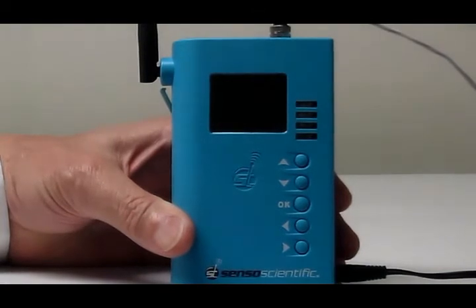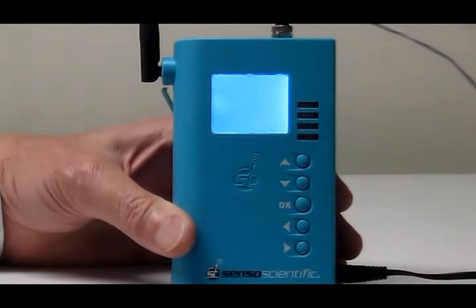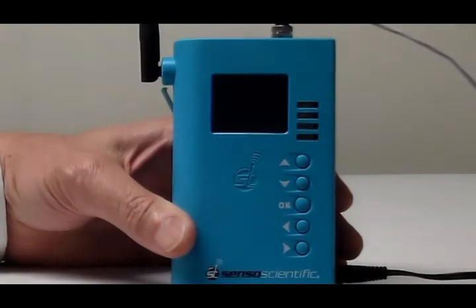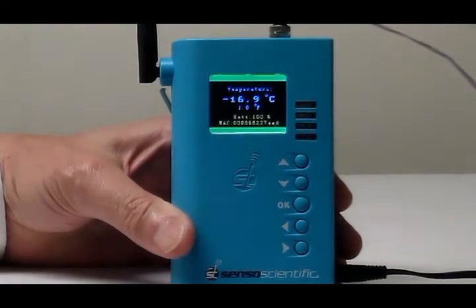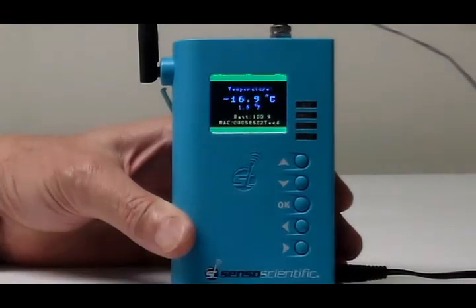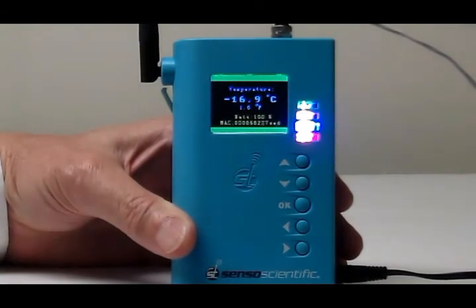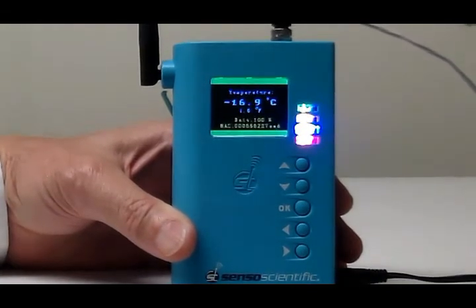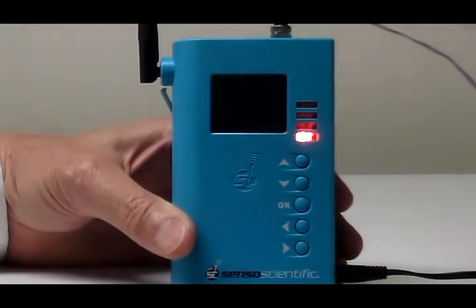If at any time you want to just see what the temperature of the fridge is, if you push the bottom button, it will bring the unit out of sleep and display the temperature of the fridge. And there it is there. Pushing the center button, the OK button, also forces a reading to be sent to the cloud server.